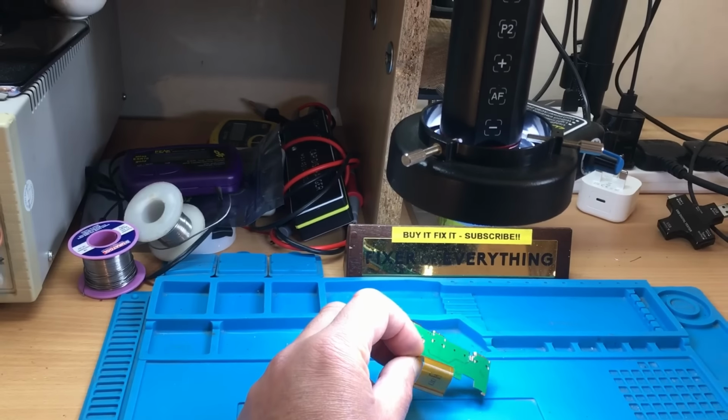So here's a little bit closer view of the little board that they've sent us with the microphone on there. And it does have a couple of numbers on it. Let's see if I can angle that a bit better just for the light. So it's got 5E02, 9W22 on it. And it seems to be soldered to the capacitor on the SD card here for power. And then it goes to these two little points here, which are just next to the SD card, just in case anybody else wants to try and upgrade one of these to add sound to it.